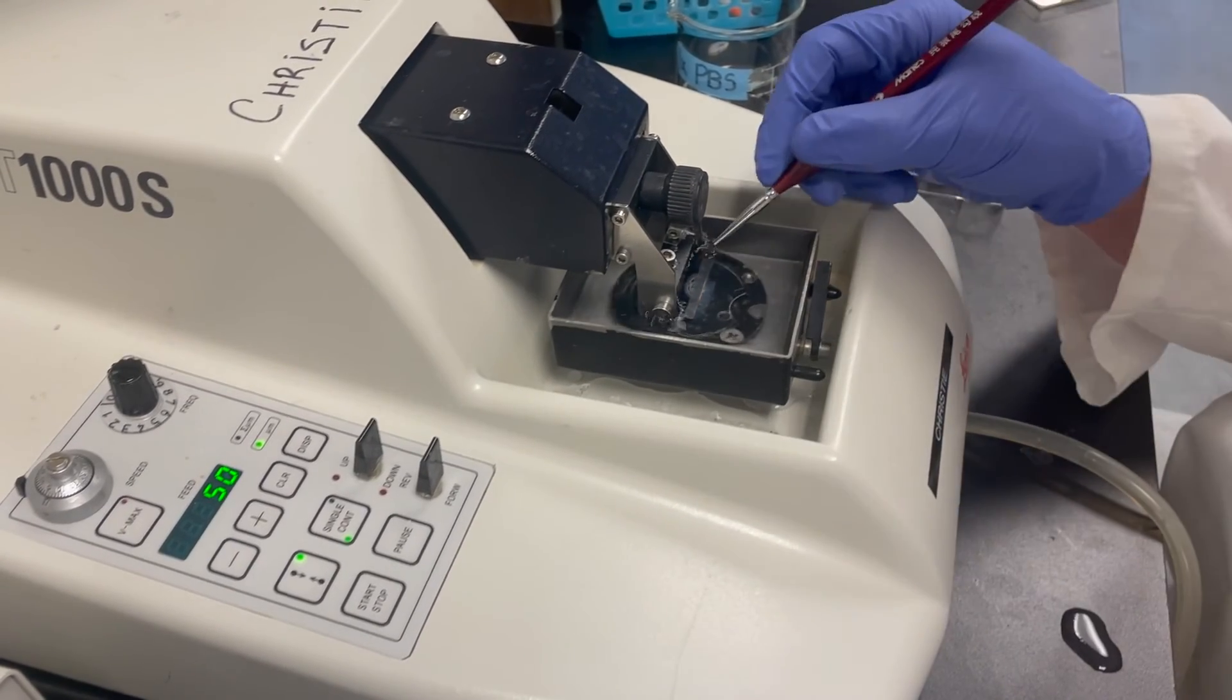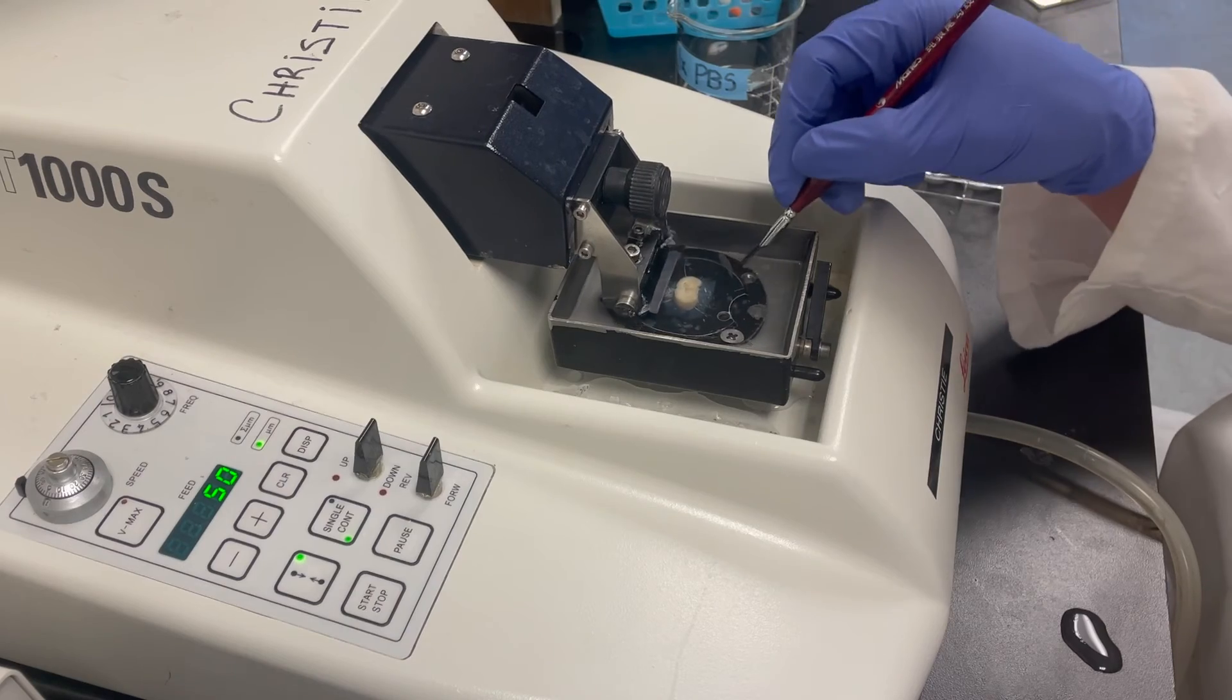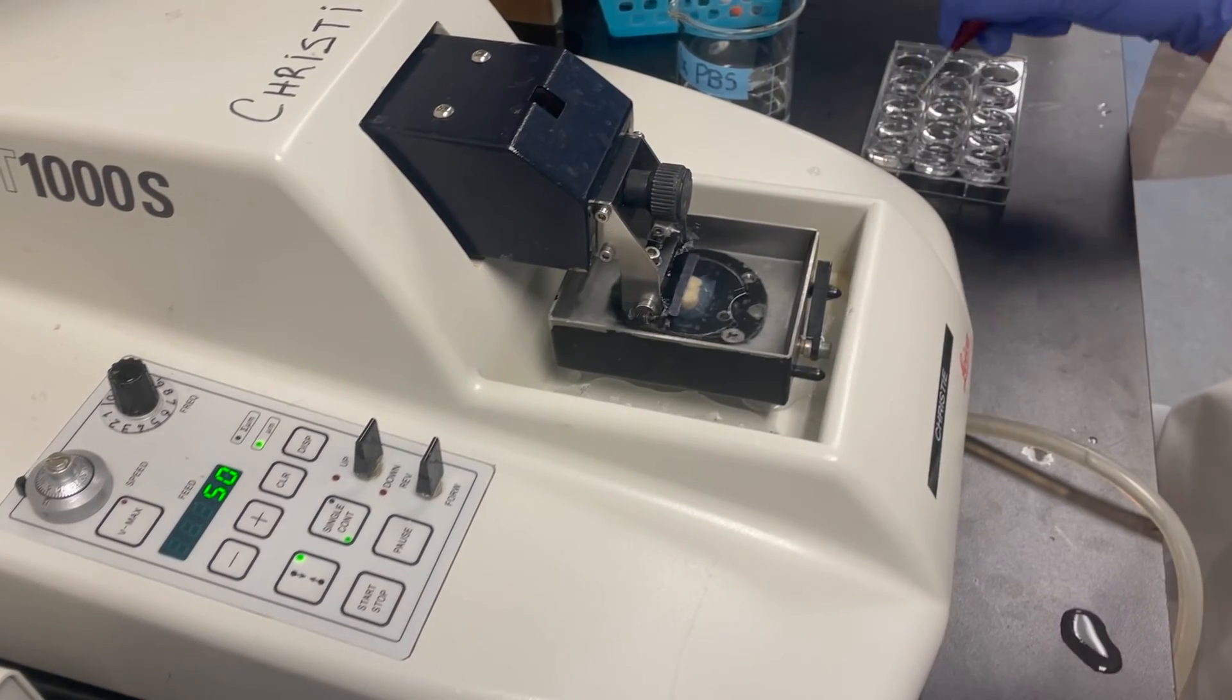To organize our plates, we typically keep hippocampal slices and prefrontal cortex slices in different well plates.